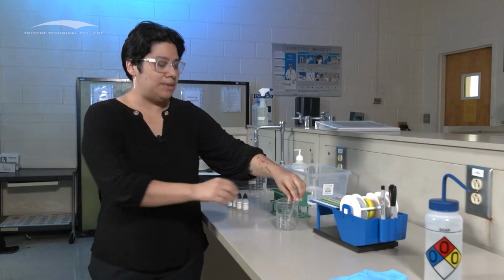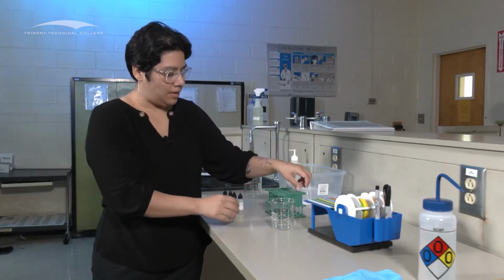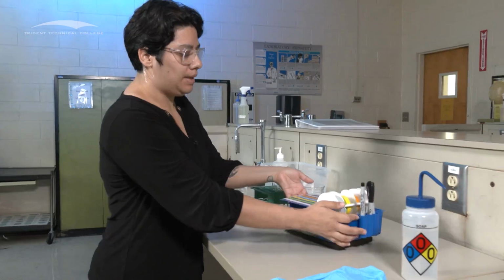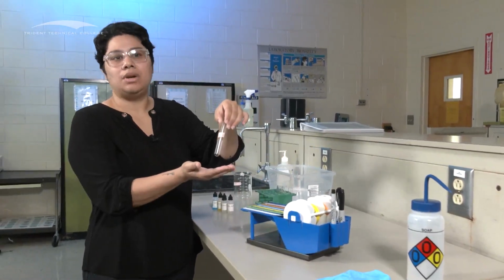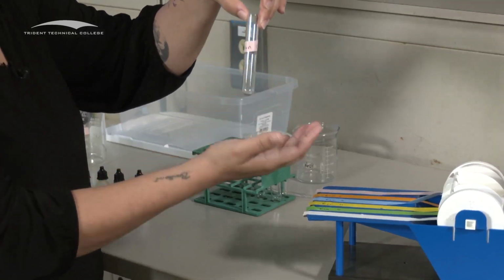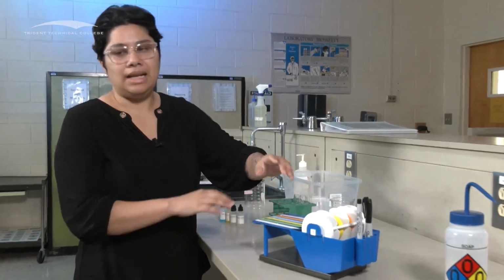And then to use a tape dispenser, because you're doing 6 different reactions, we want to make sure that we label all our reactions. And I have a couple of them pre-labeled for you. So I did reaction 1 already, so it should look like this. And you can do 1, 2, 3, 4, 5, 6. I like to do RxN for reaction, but as long as they're labeled, any type of labeling that you can differentiate between them. And then I like to use different colors.